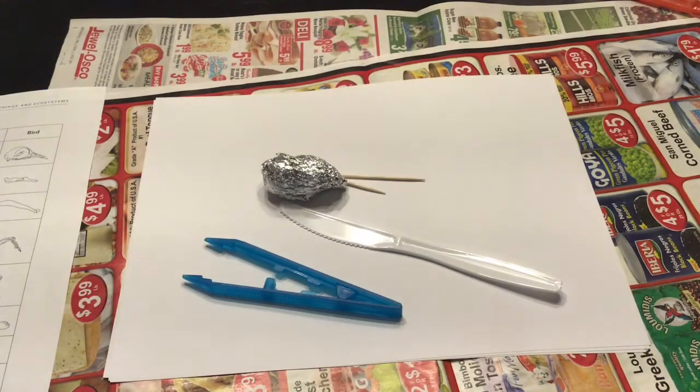When owls eat, there are certain parts of their food that they cannot digest. They compress the parts they cannot digest into a pellet. Then they regurgitate, which means throw up, the pellet as waste. It might be difficult for you to directly observe an owl hunting and eating, but you can look at the owl's waste to find out what an owl eats.